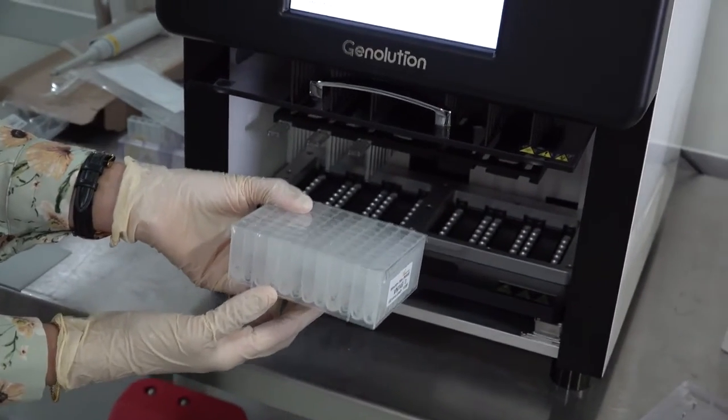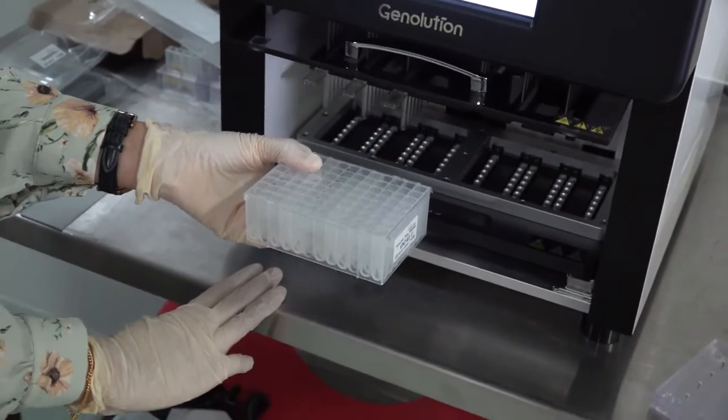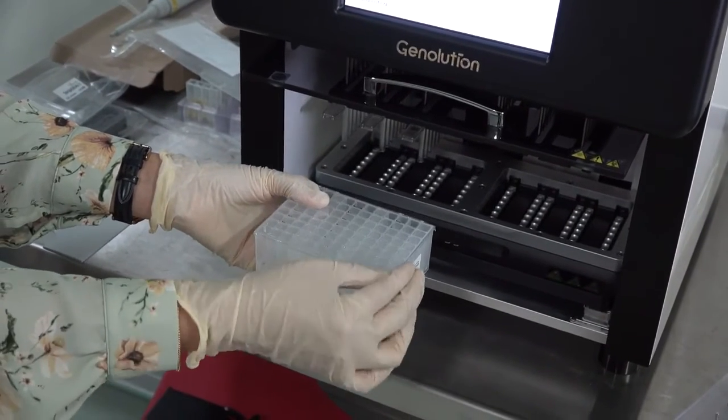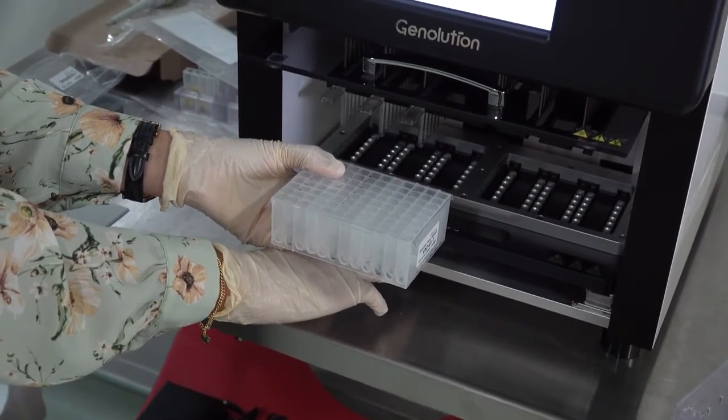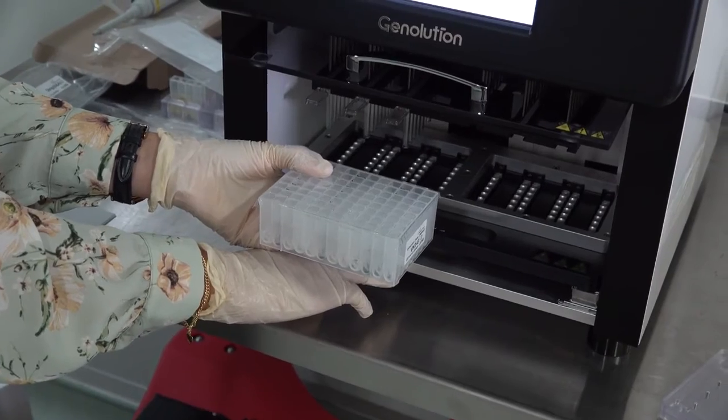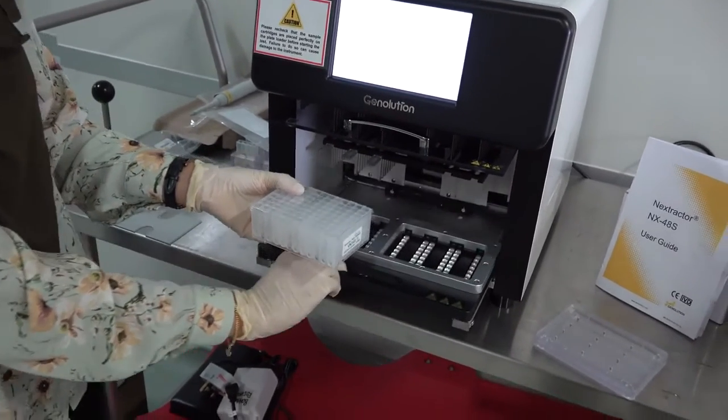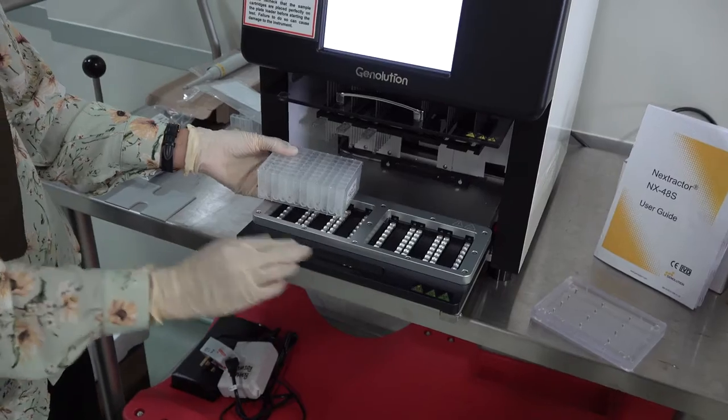Now we will mount the block. Once you load all your samples into these wells, the cover is basically stripped off so you don't have any kind of issues regarding spillage during transit. Once you finish loading the well, you can load the entire block into the system.